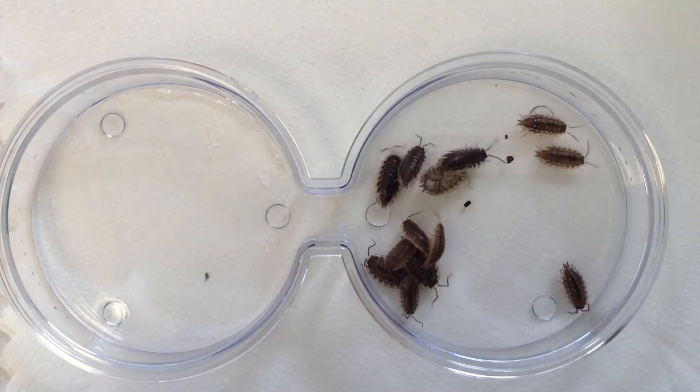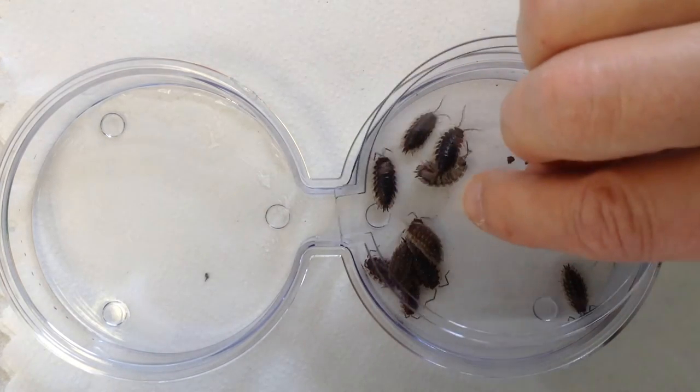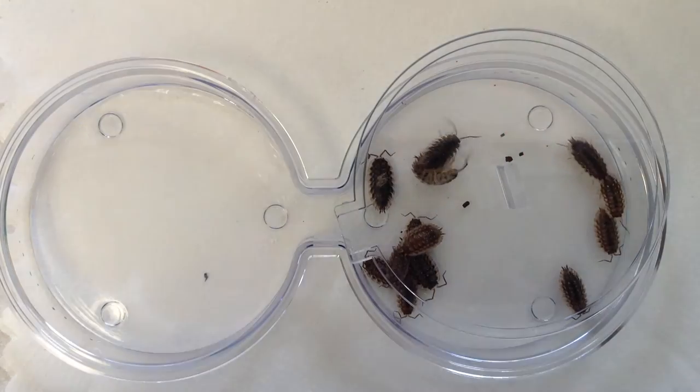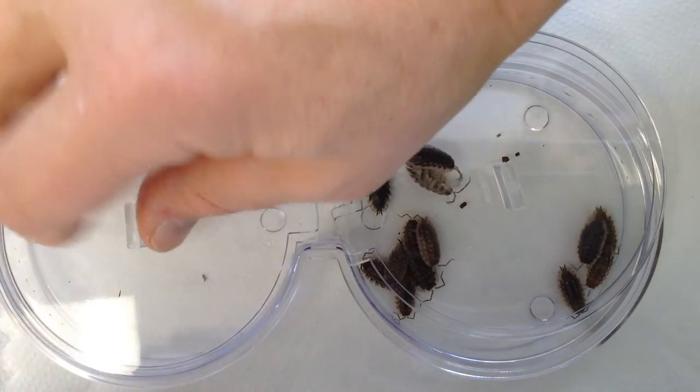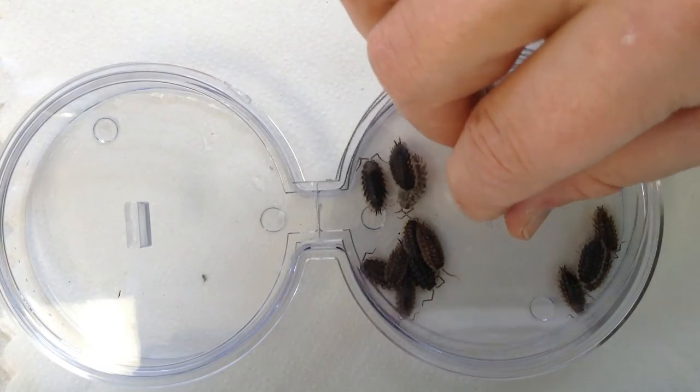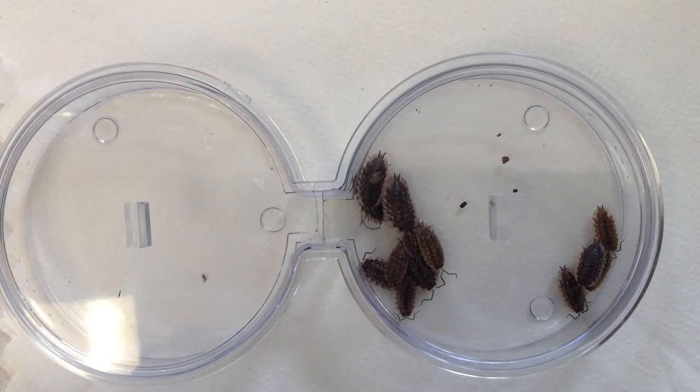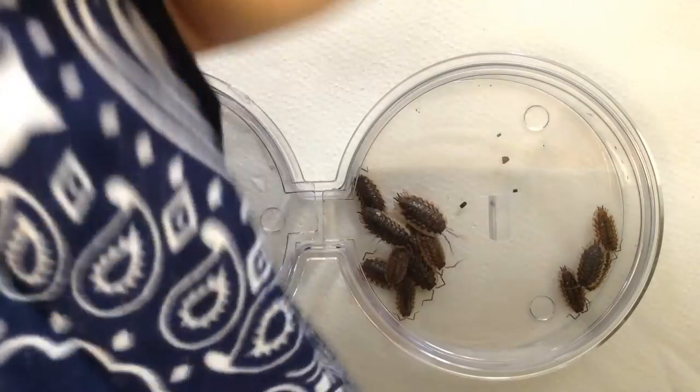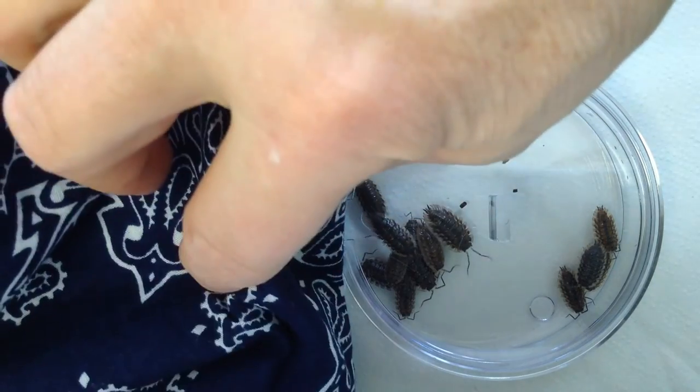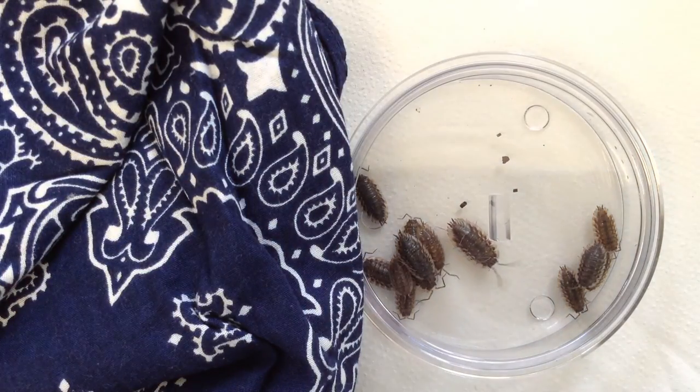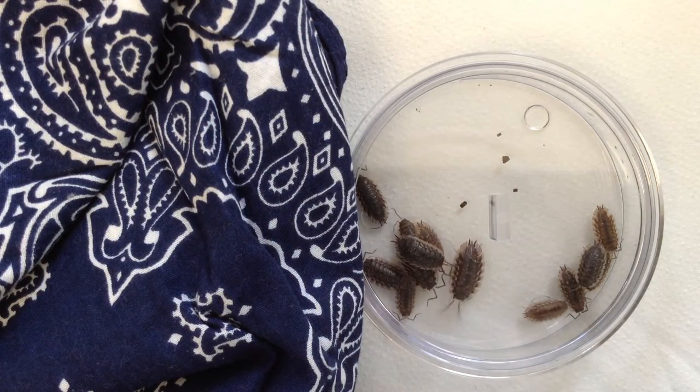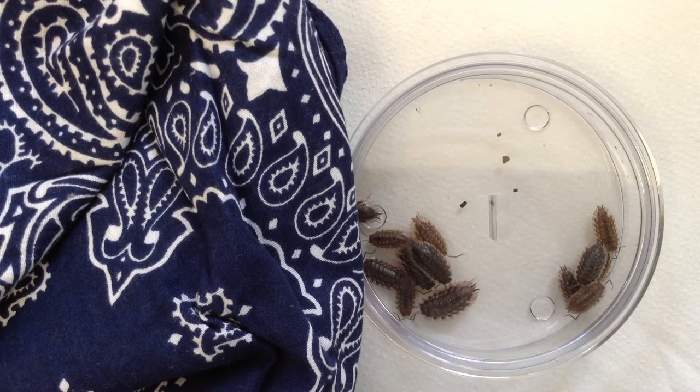And this time we're going to give them a choice. Do they like the light or do they like the dark? So we'll cover up one side and leave the other side open, and we'll wait a bit and see what they decide to do.